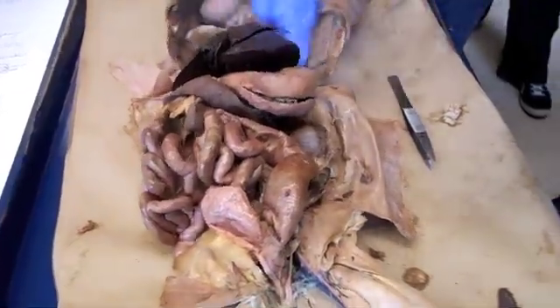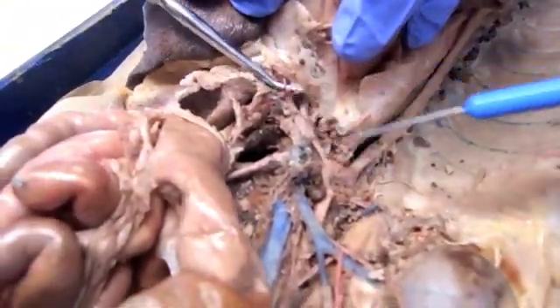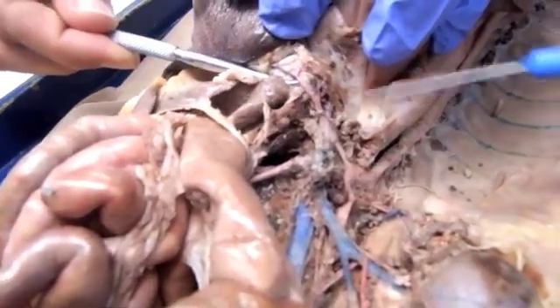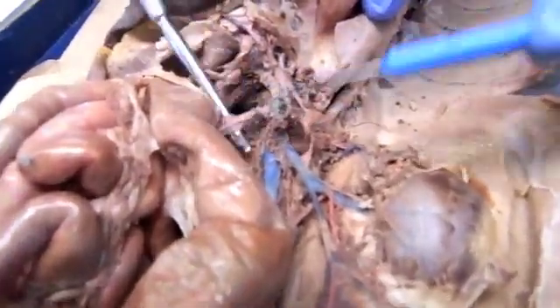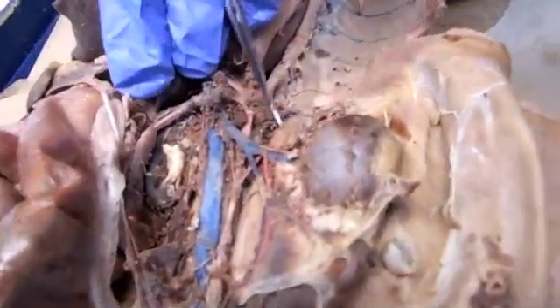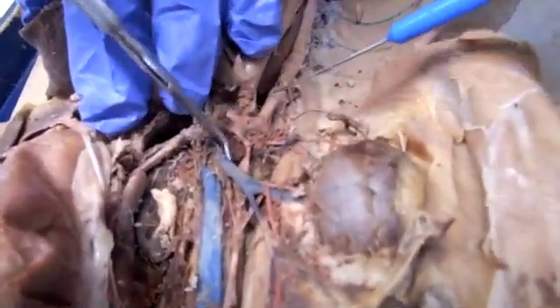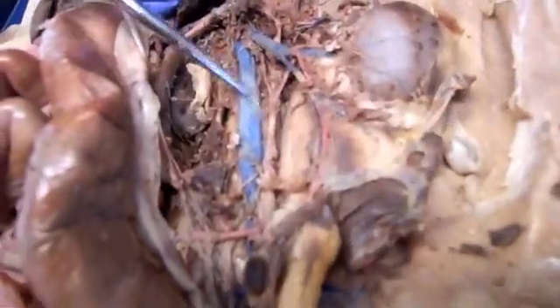Your thoracic aorta, when it hits the diaphragm right here, turns into the abdominal aorta. So you have your celiac, your hepatic, left gastric, gastrosplenic, and then your superior mesenteric. You have your adrenal, lumbar — which is here — your renal artery and vein, and your testicular artery and vein.